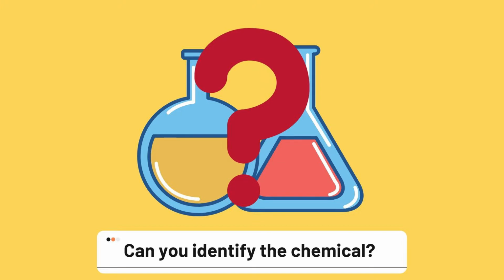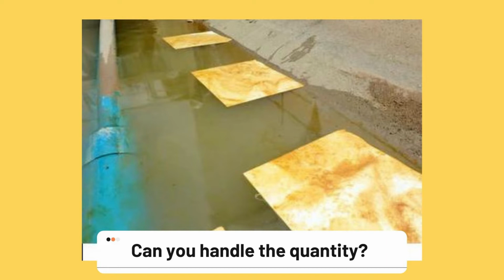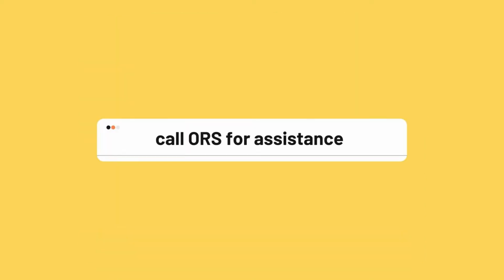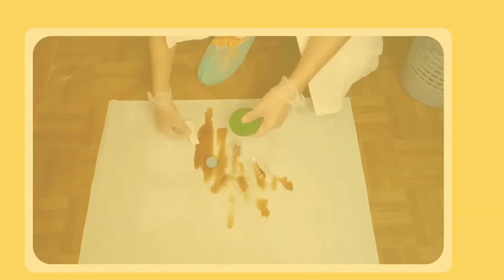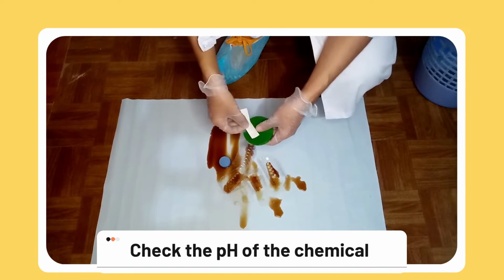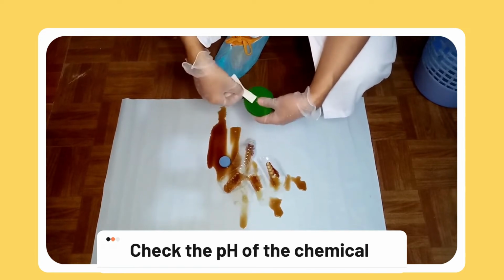Also ask, can you identify the spilled material? Is it a quantity you can handle? Is it spreading? If you are having trouble with the spill, call ORS for assistance. Identify the spilled material and also check the pH if any of the spill looks like water.